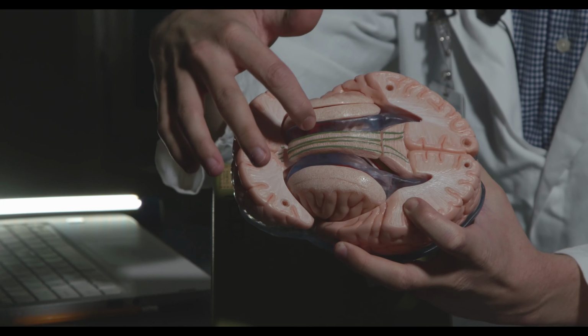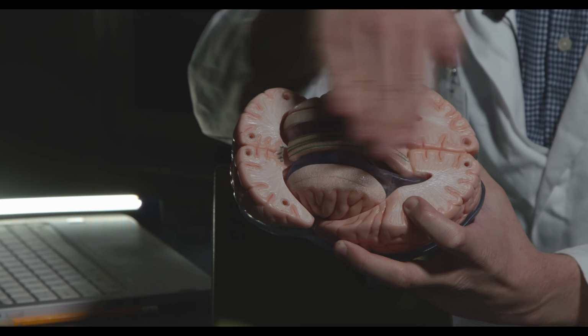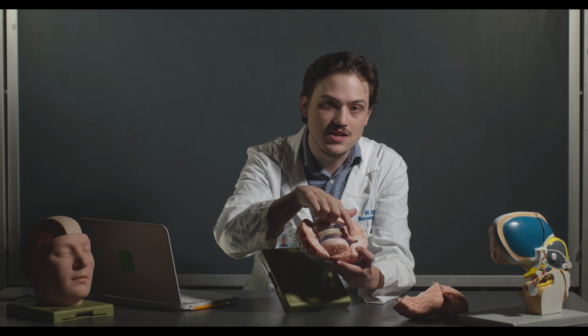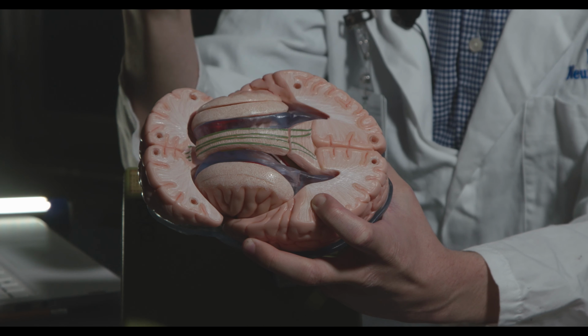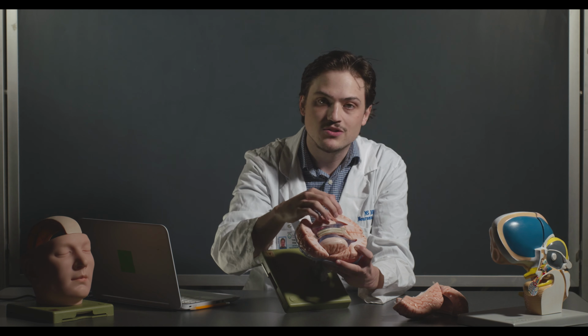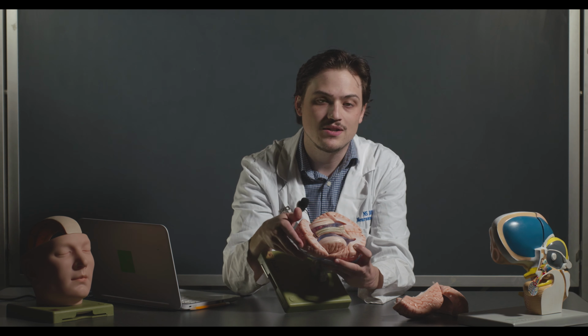Here you can see the lateral ventricles. We're really going to keep making a bunch of cuts on the actual sheep brain until we can start to see this opening. Right here they have it as an actual structure, but they're essentially holes in the brain where you have cerebrospinal fluid. So we're going to cut down until we get to that, and we'll start to see the hippocampus peek through there, and that's essentially what we're going to dissect out.